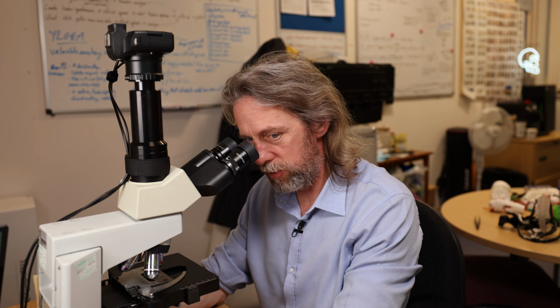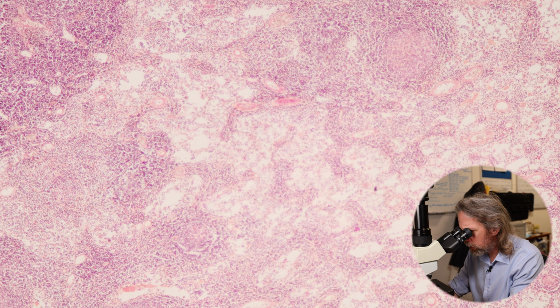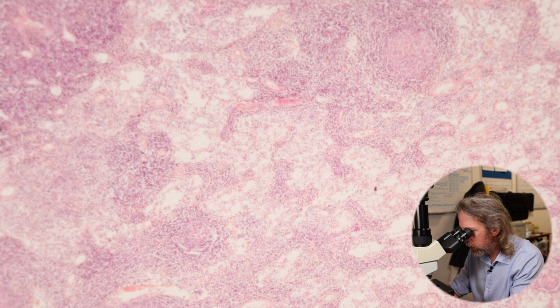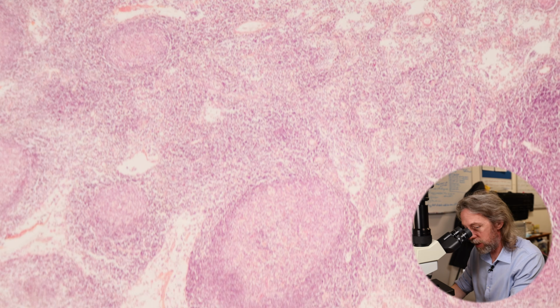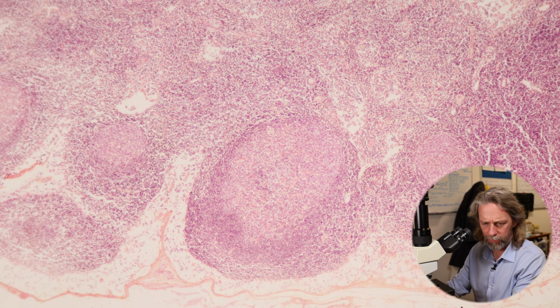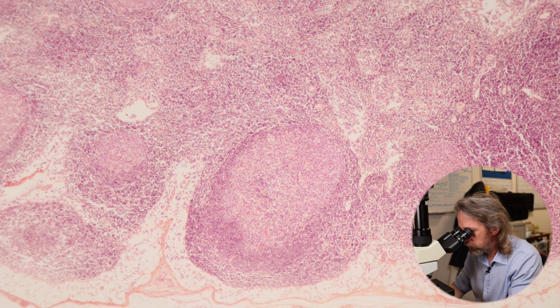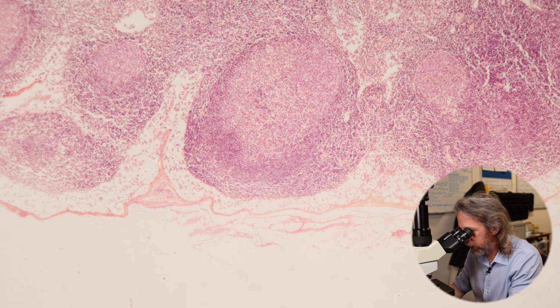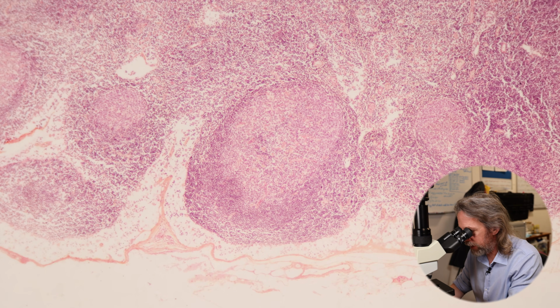So the lymph node is not a mythical beast like the haggis. It is a real structure within the body. This is where the immune system resides. The immune system itself often feels fairly imaginary at times, but it is vital. And we talked about how we've got a nice capsule, a subcapsular sinus where the fluid enters.